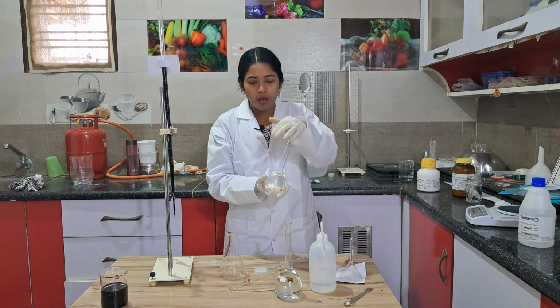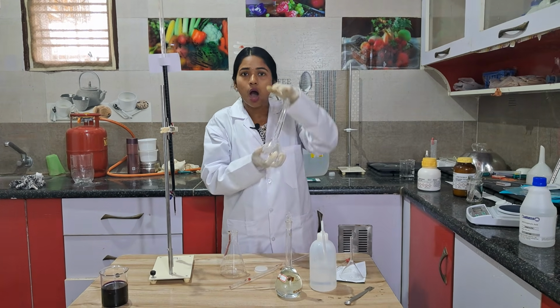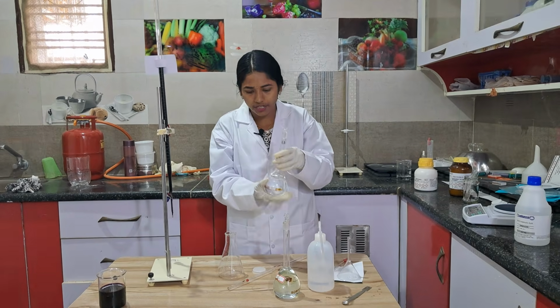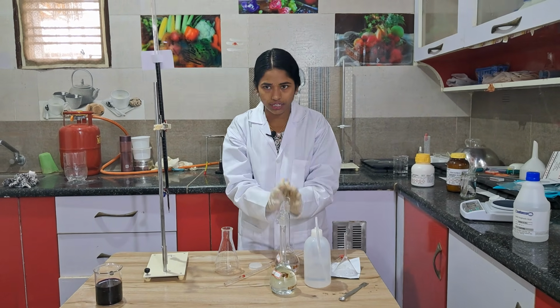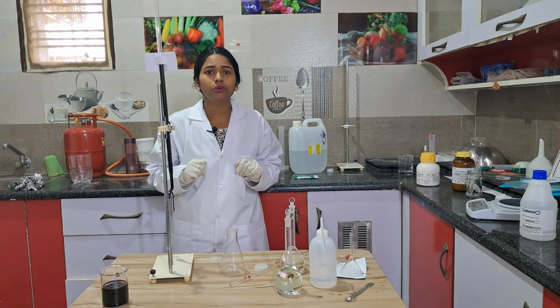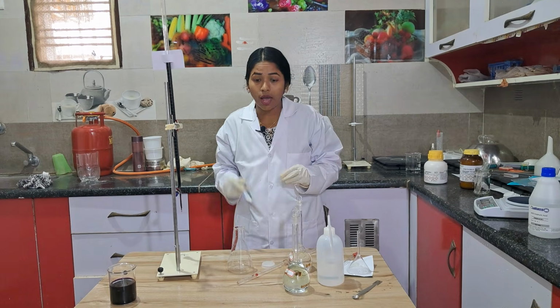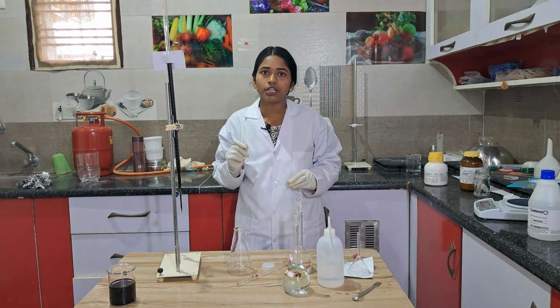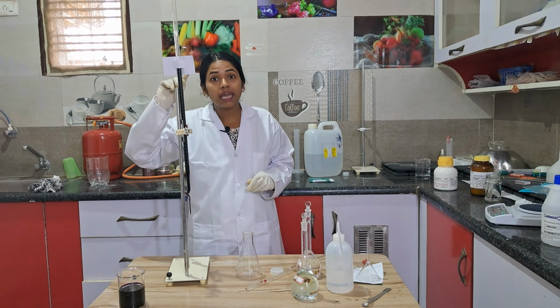So this is 0.1 molar oxalic acid. I will tell you how to prepare it in the calculation part at the end. You take 3.15 grams and dissolve it. What I am going to do in this video is not simply do the titration and tell you; I am going to tell you each and every calculation part also. Even I am going to tell you how to prepare KMnO4 also.